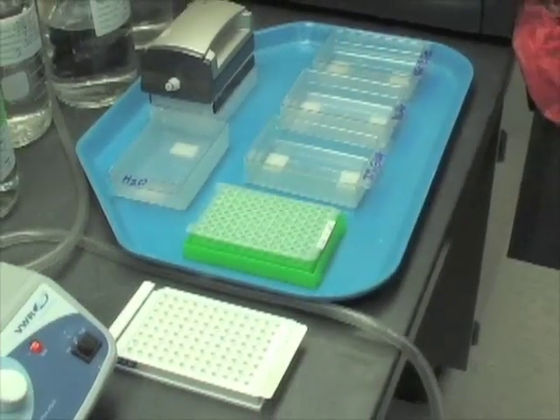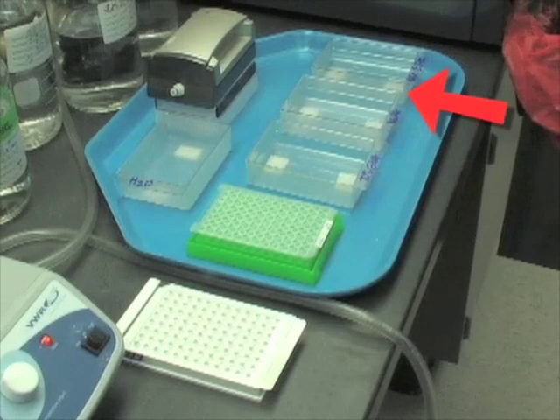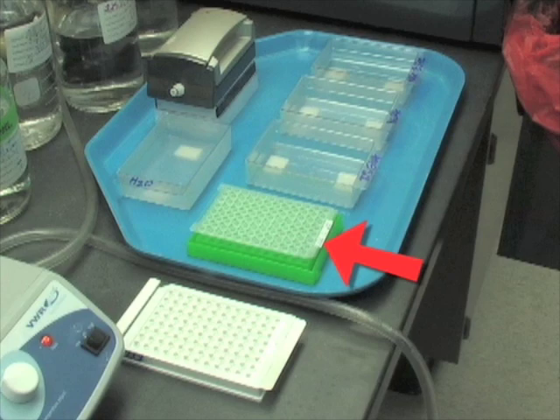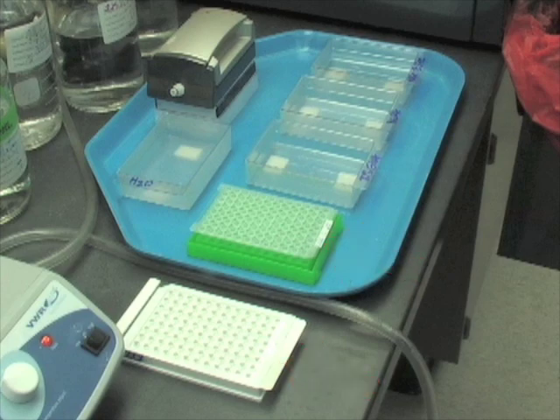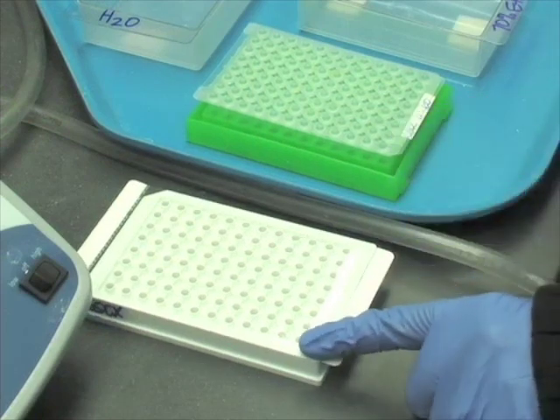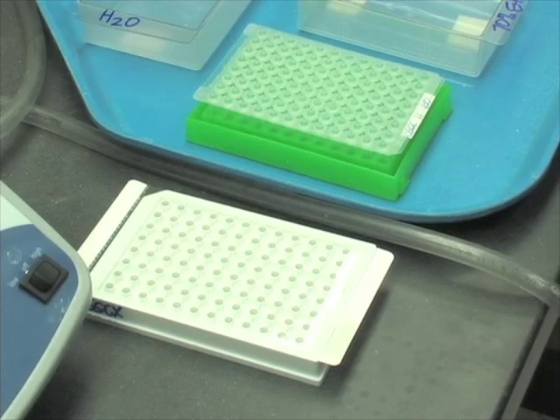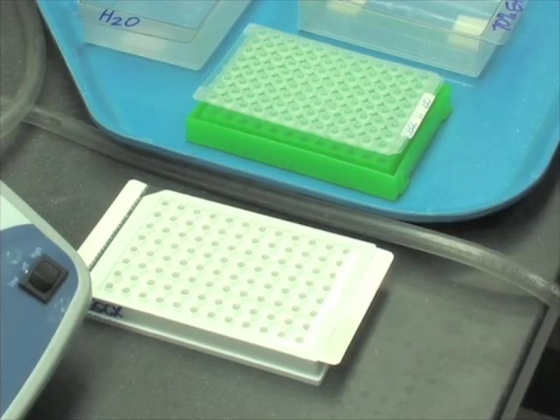Set up a workstation for prepping the plates that includes the reagent troughs, PCR product and bead mix tray, and the pyrosequencing primer tray. Make sure that the PCR product and bead mix plate, as well as the pyrosequencing primer tray, are properly aligned so that the negatives are in the same orientation before transferring samples.